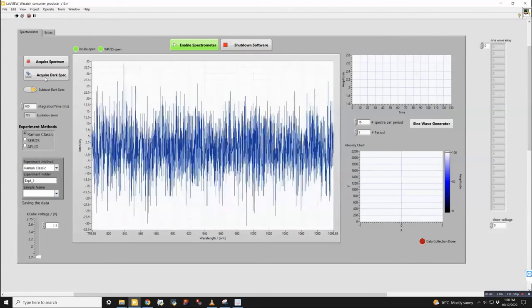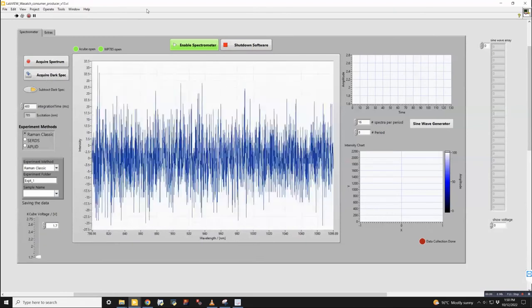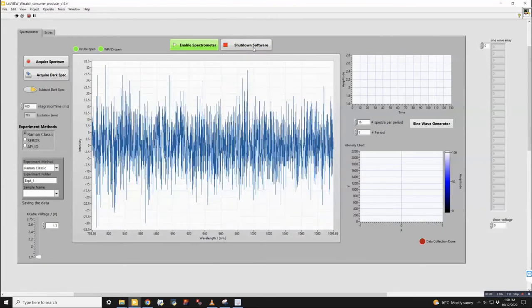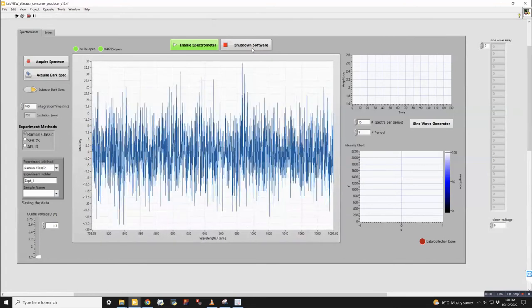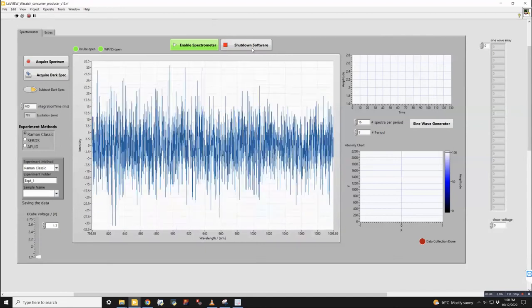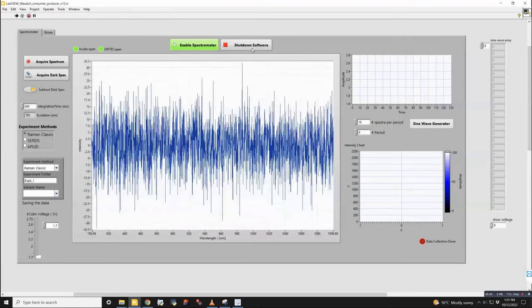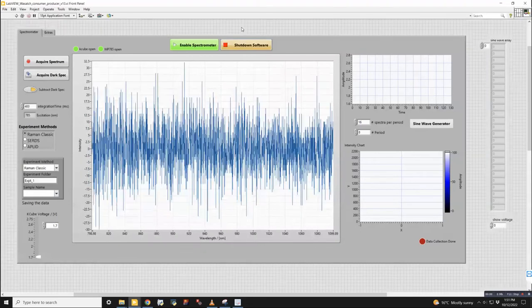And I think that this is automatically output to another file as well, or it's automatically subtracted from the spectrum when something is saved. So as important as turning on the software is, turning off the software is important. You need to use this shutdown software button here. And what that does is it ensures that all the different pieces of hardware connected to LabVIEW is disconnected properly so that it can be connected to by LabVIEW itself later or through their native softwares like the KLC software and the Wasatch probe software. So if I hit shut down, it takes a second, but then it's totally disconnected. And now I could restart this program if I wanted to, or connect to it with the other ones.